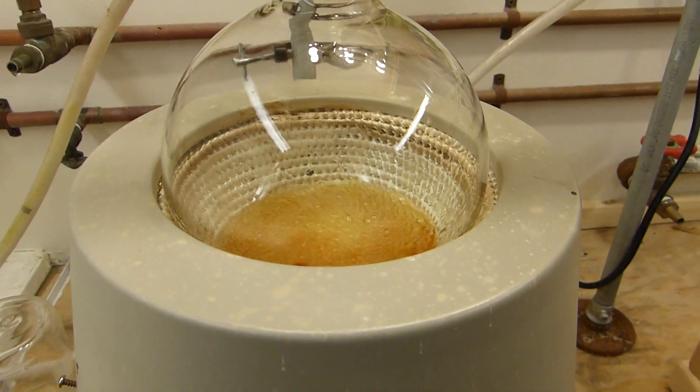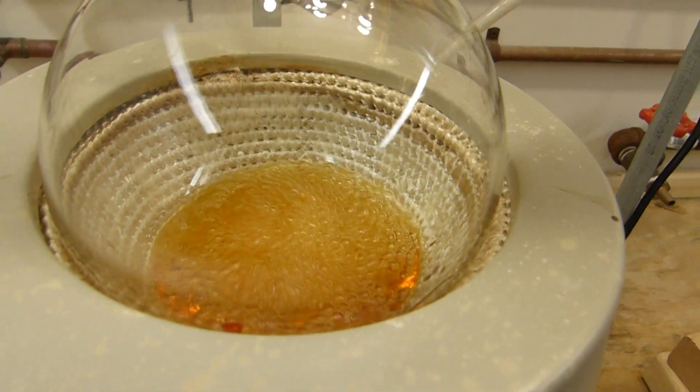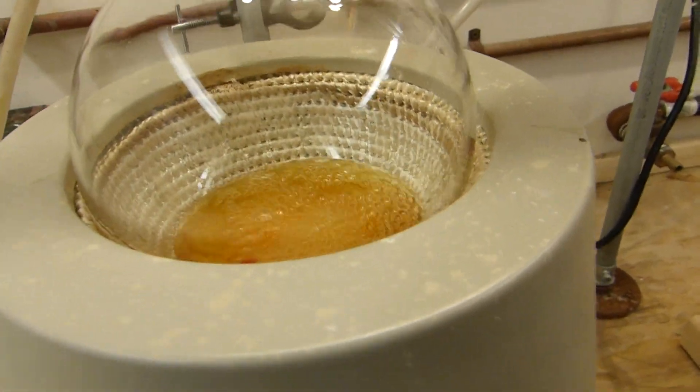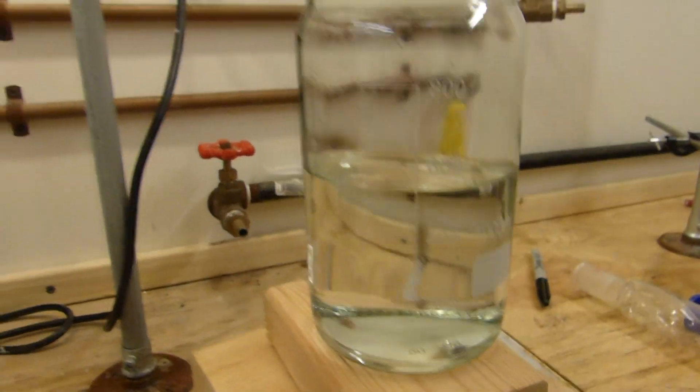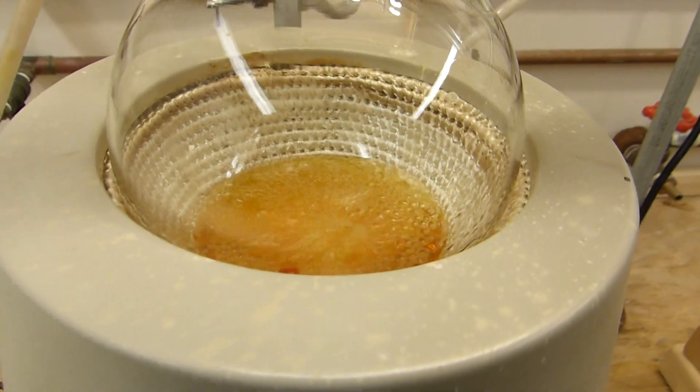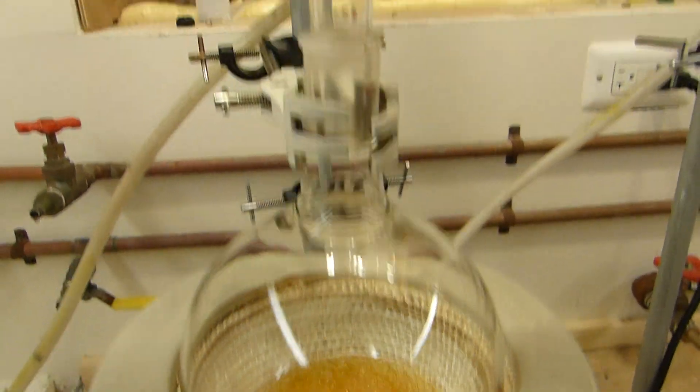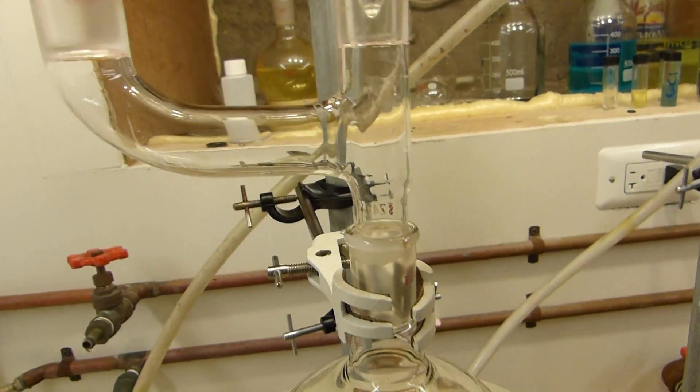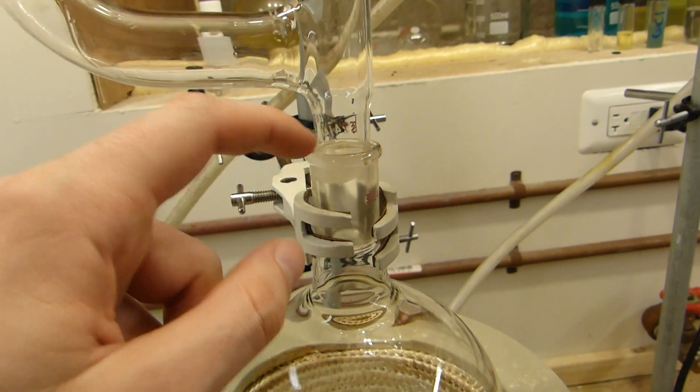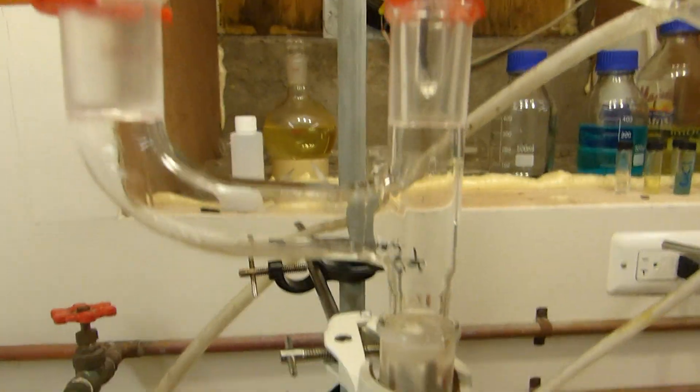Well, it's been five or six hours and I've distilled most of the glycol over. You can see all the impurities have been concentrated in the bottom there. I can turn the stirrer off, you might be able to see the color of that a little bit better. But anyway, I've collected just over 500 milliliters of reasonably pure ethylene glycol from about a dollar fifty worth of antifreeze. So even if there is glycol still left in here, I'm not going to be too sad about throwing it away. This has been showing 198-ish Celsius for several hours, which is indicative of pure glycol coming off. That's good. One thing that could have made this go faster is if this column was shorter, but I felt the need to potentially add more glycol as I went, but I think that the 550 milliliters I've collected should be sufficient. I also melted a couple of my Keck clips. They're apparently not well suited for sitting for six hours at temperatures of about 200 Celsius.